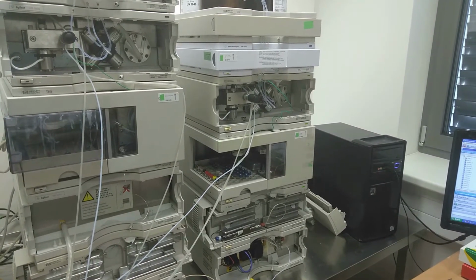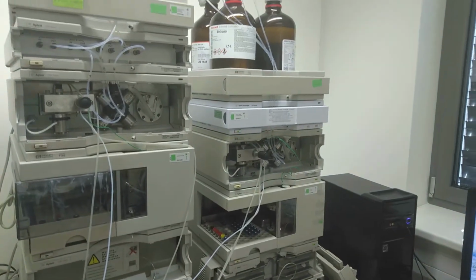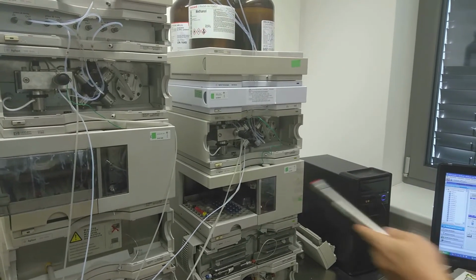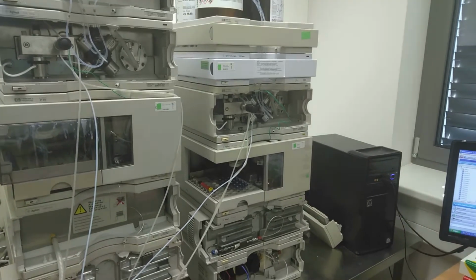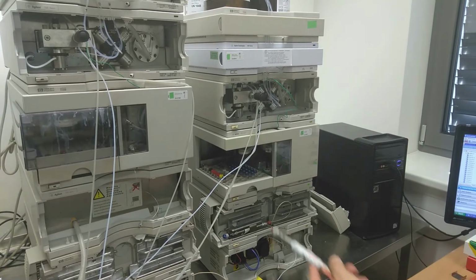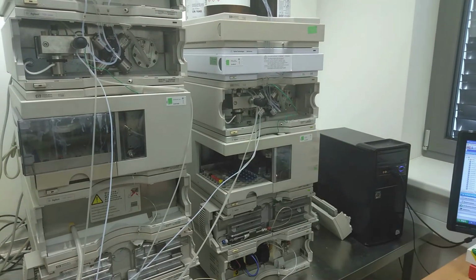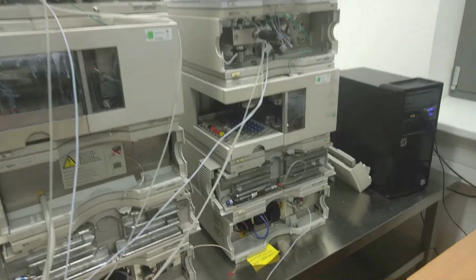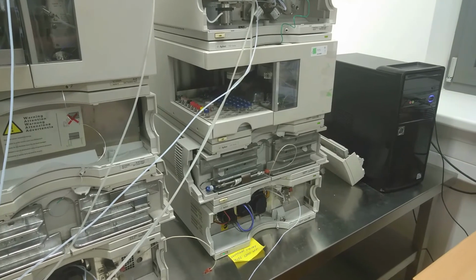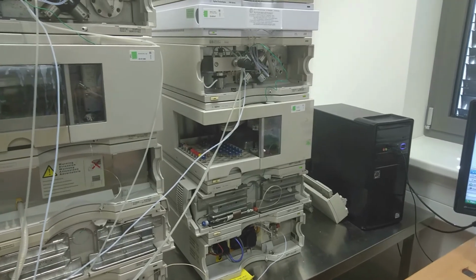The pump is pumping the mobile phase to the system with a constant velocity, and we are waiting for the mechanical hand to take the vial with the sample to bring it under the needle, and the needle will perforate the septum of the sample vial and will draw a selected amount of the sample from the vial and consequently will be connected to the system and the material for injection will be loaded to a chromatographic column.